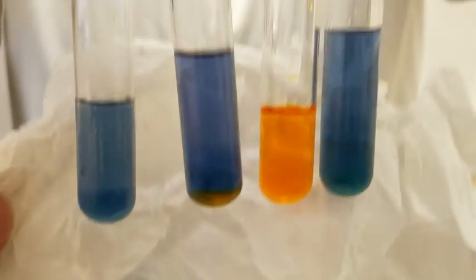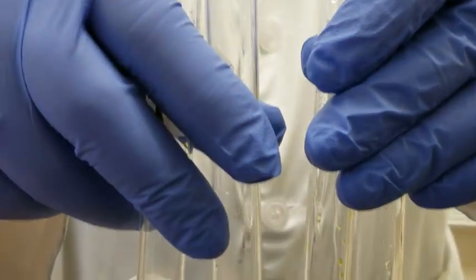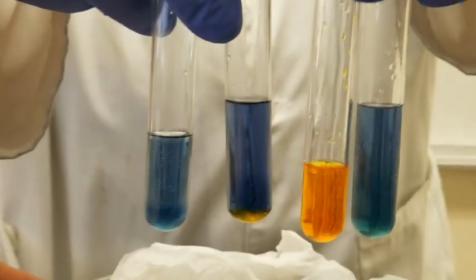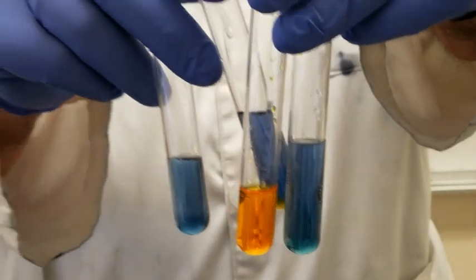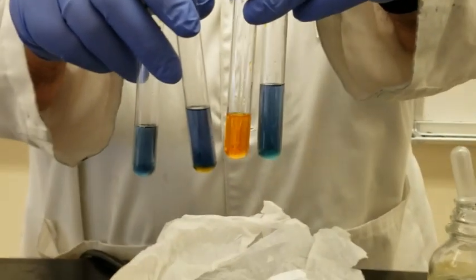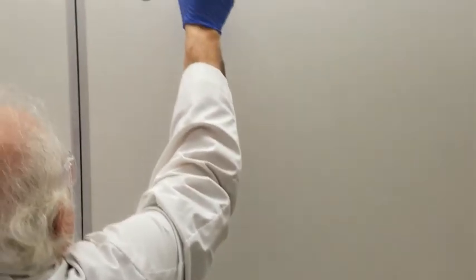So that takes care of the Jones test. Are we in agreement here? Do we see that? Okay, so from your left to your right. The first one is a primary alcohol, and secondary one is here. Tertiary one has no reaction, the unknown has. So this means my unknown is either a primary or a secondary alcohol. Are we in agreement? Any questions? Okay. It's going to be called Lucas test.